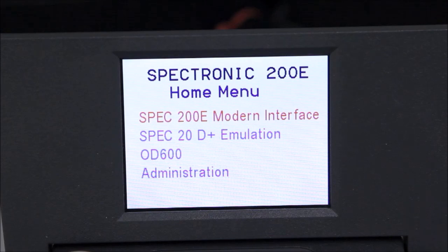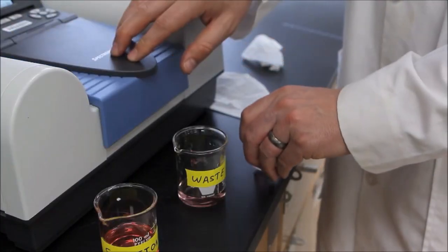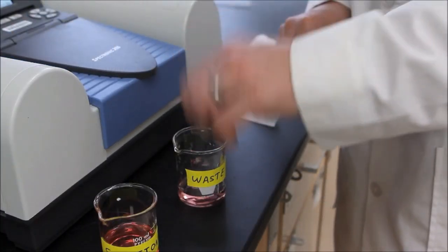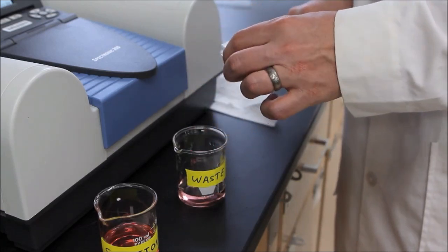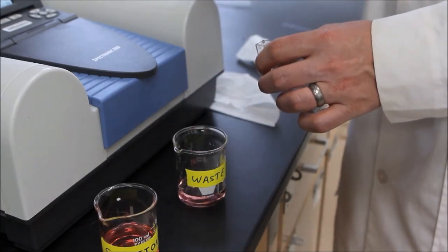When we are finished, return to the home menu, remove the cuvette from the cuvette holder, pour its contents into a waste container, and clean the cuvette with at least three volumes of deionized water.